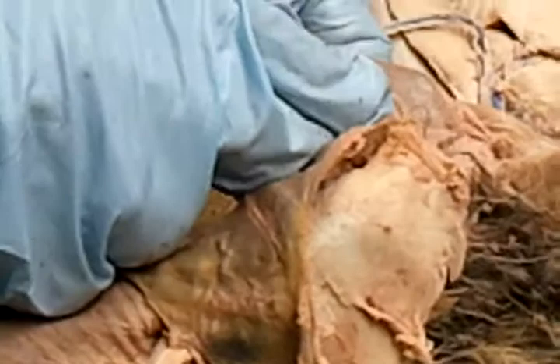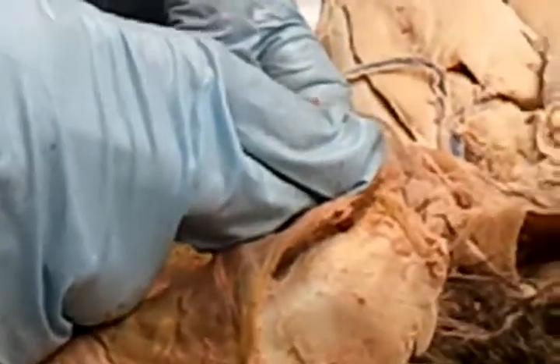We're going to talk about this mesentery, which is called the mesentery. And then after we get through the small intestine, you can see the much larger diameter is the large intestine, which comes down. The reason we can't pull that up out of the cadaver, oops, there it is. There's the rest of it. The yellow represents a different type of injection for the hepatic portal system, which we'll go into later. But we can't pull that up out of the cadaver either because it's attached by its mesentery.